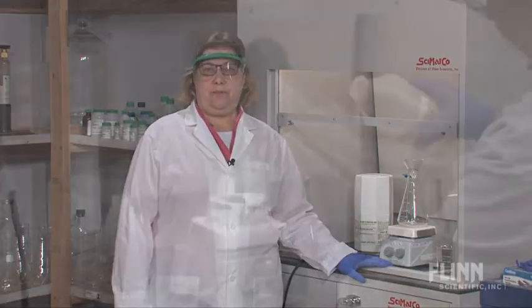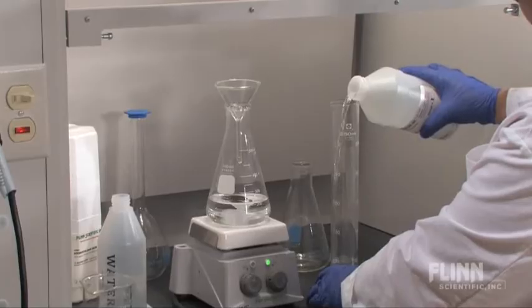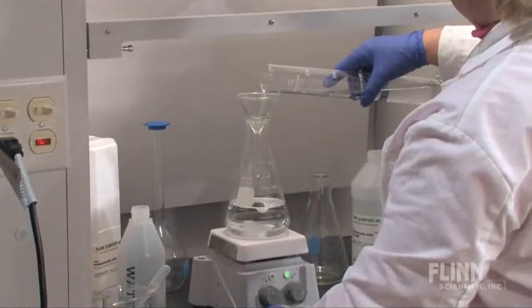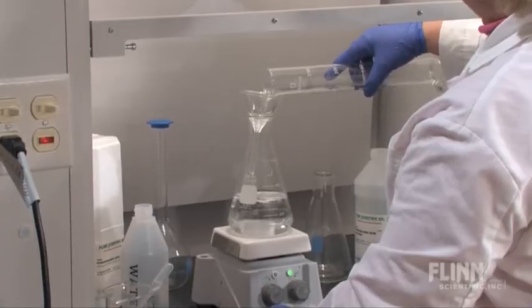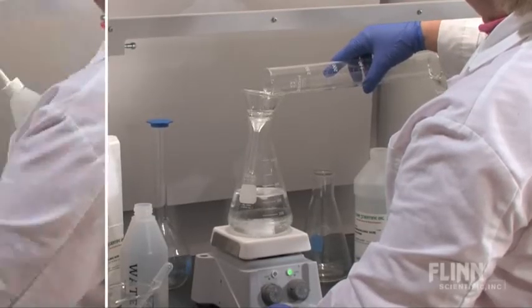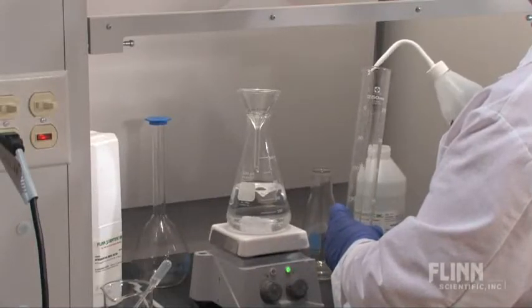Diluting an acid with water releases a large amount of heat. Water acts as a heat sink to regulate the temperature. Measure the acid into the graduated cylinder and slowly pour the acid into the flask using a funnel. For best results, stir the solution throughout. Rinse the graduated cylinder and the funnel with water. Remove the stirrer and rinse it as well.